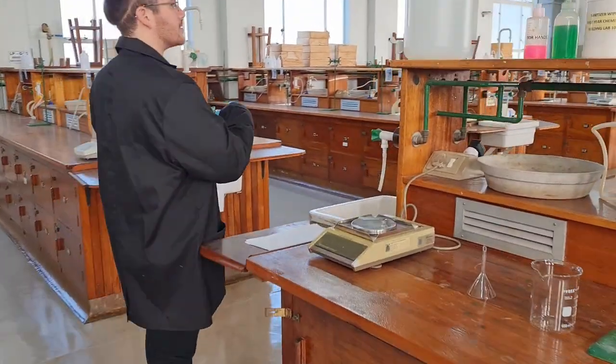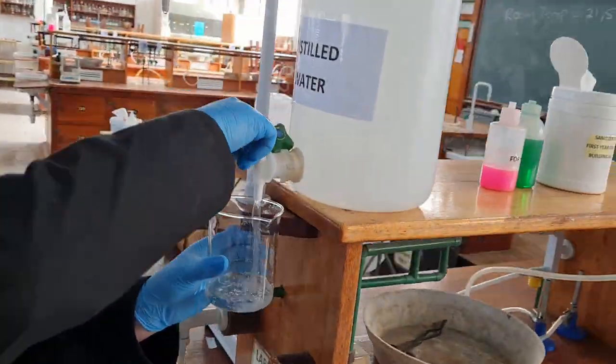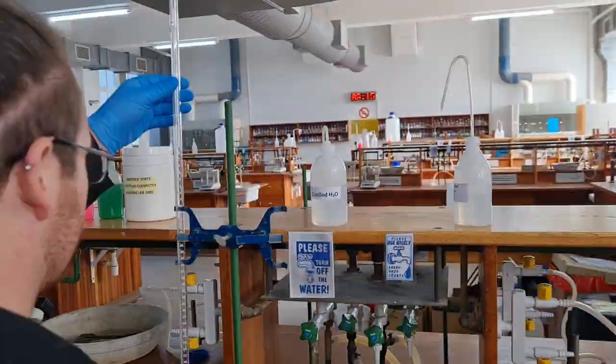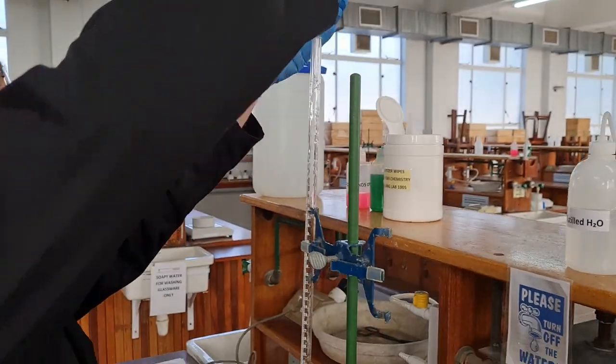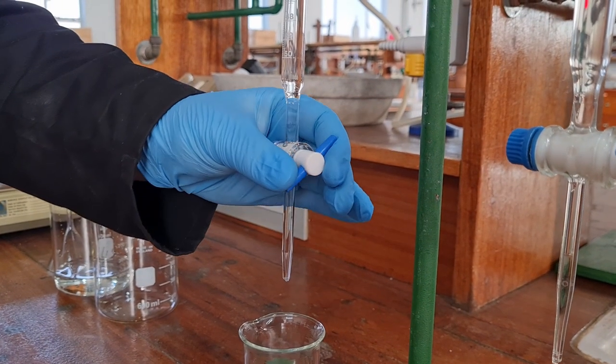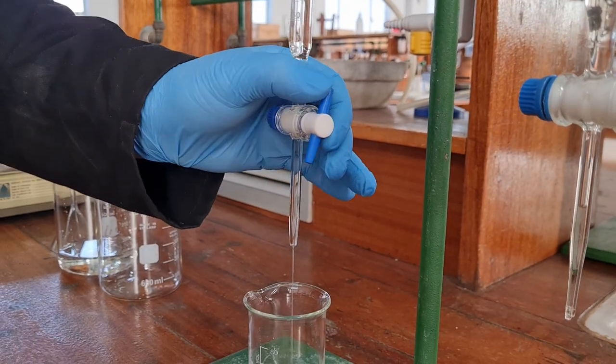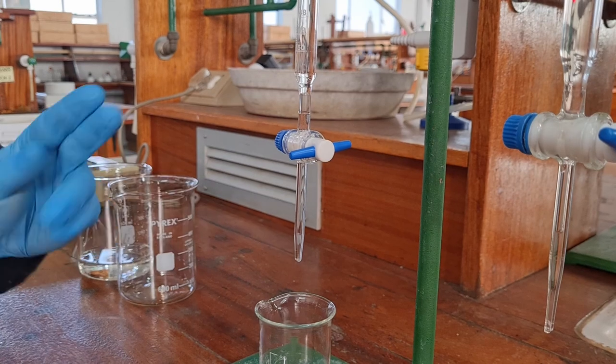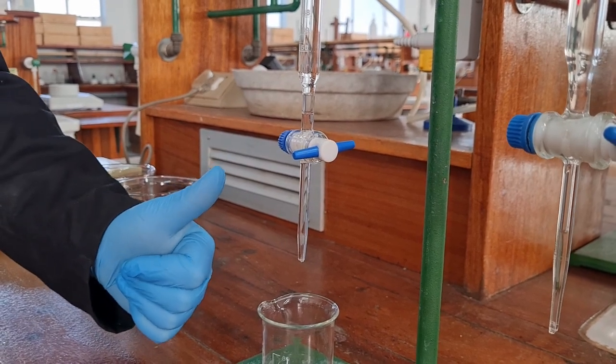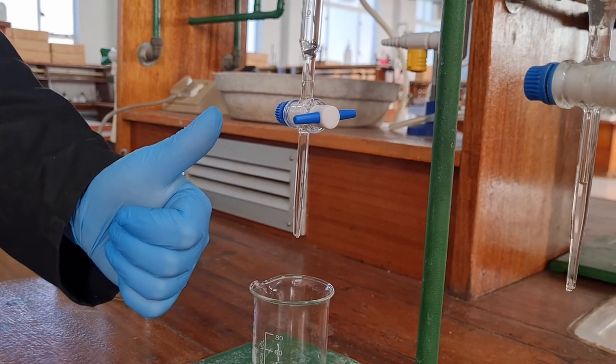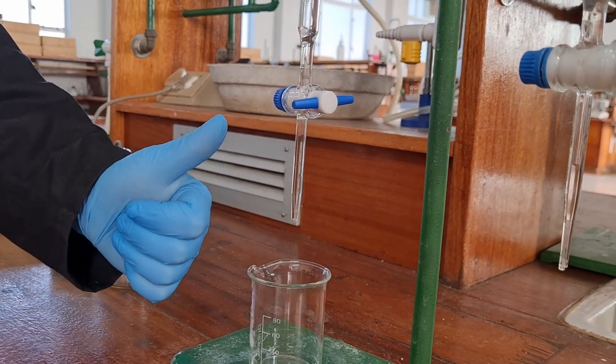Before using a burette, fill the burette with tap water. Ensure that the tap turns easily and doesn't leak, that the burette point is not blocked, and then drain the burette completely.